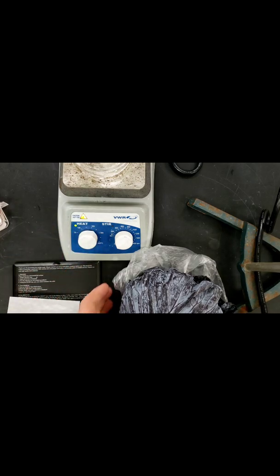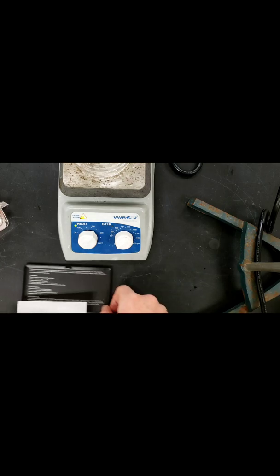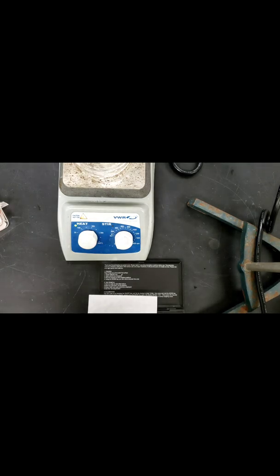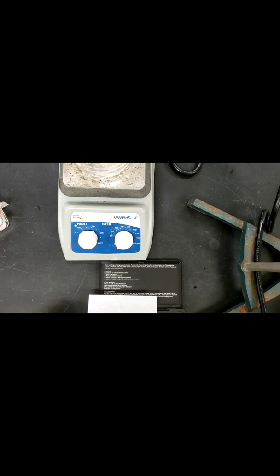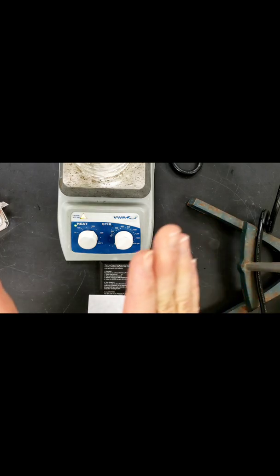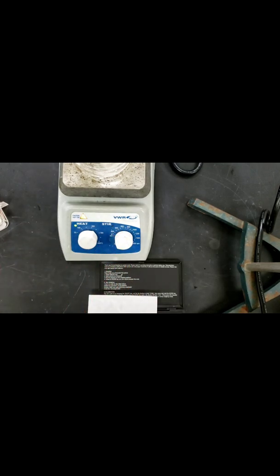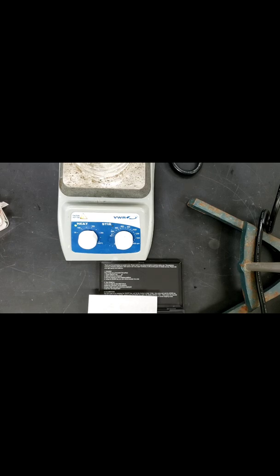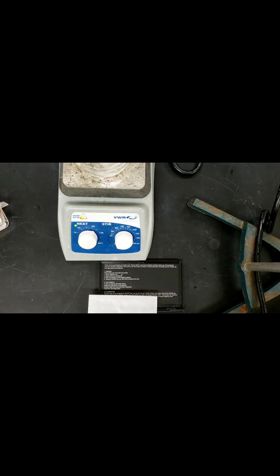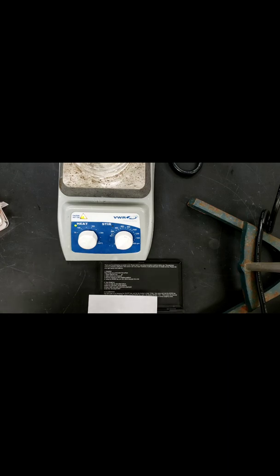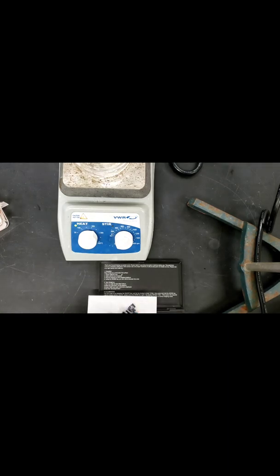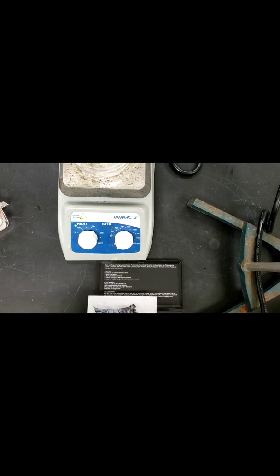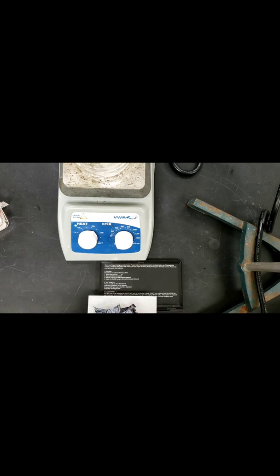You can do this by boiling cabbage either in the microwave or on the stove. I'm going to use a hot plate here to represent our stove. Make sure you have a very clean container. Wash it with soap and water. We're going to add about 100 milliliters of water. We're going to add about 10 to 11 grams of this red cabbage. I'm currently heating my 100 milliliters of water.